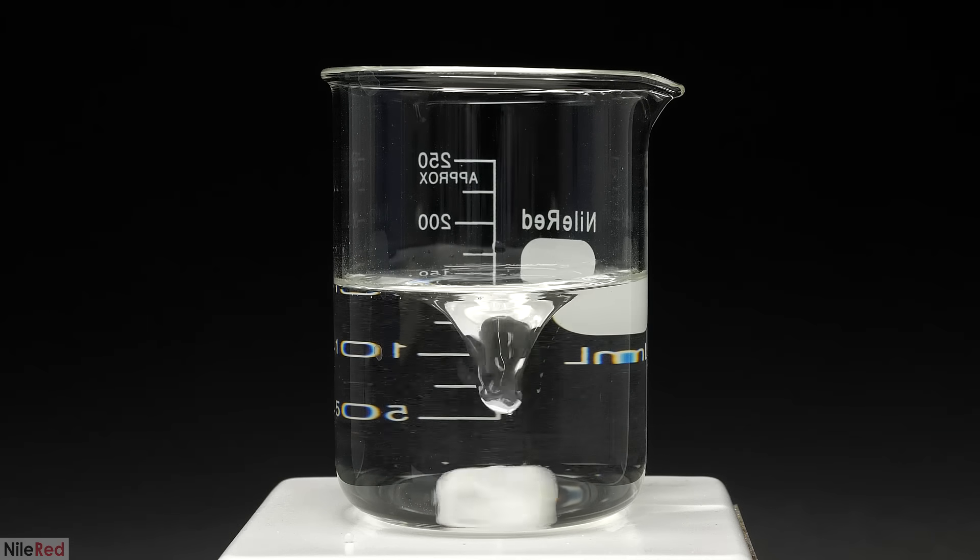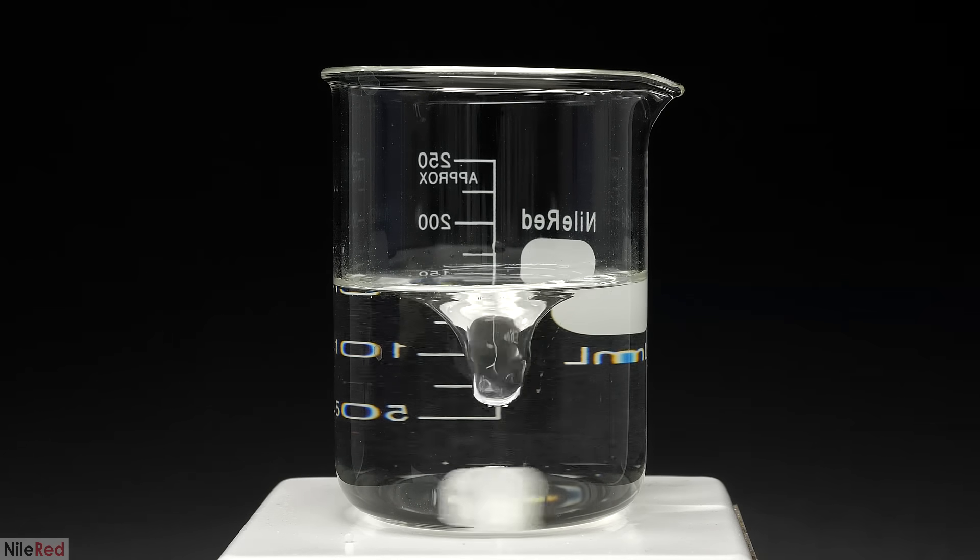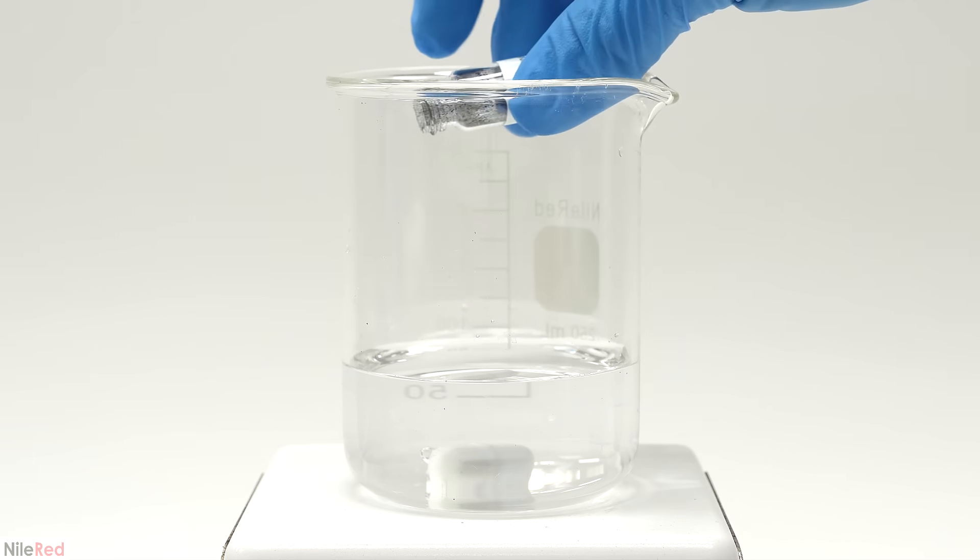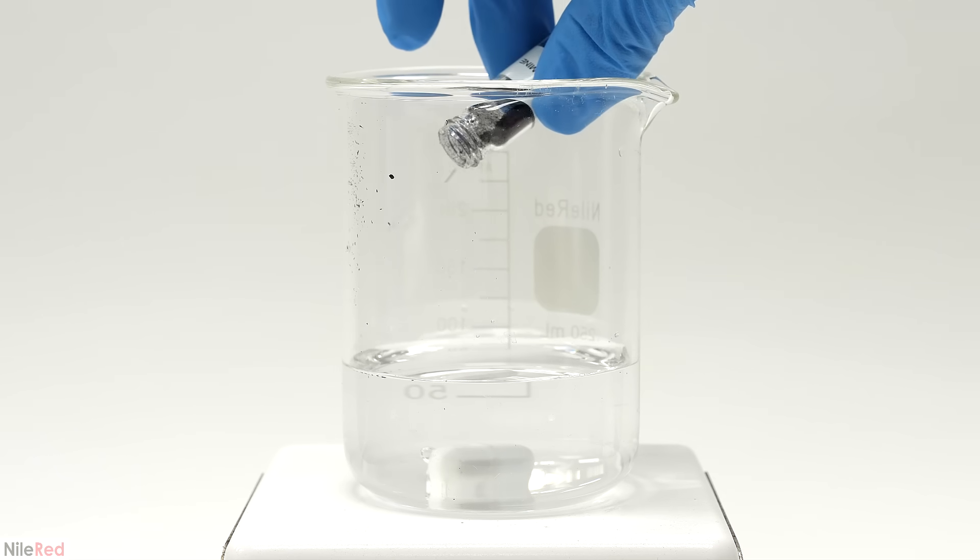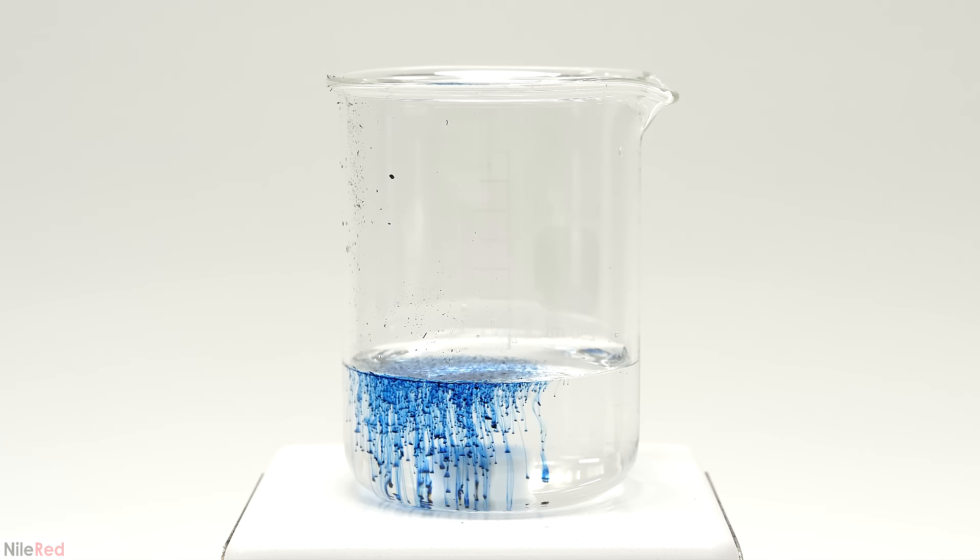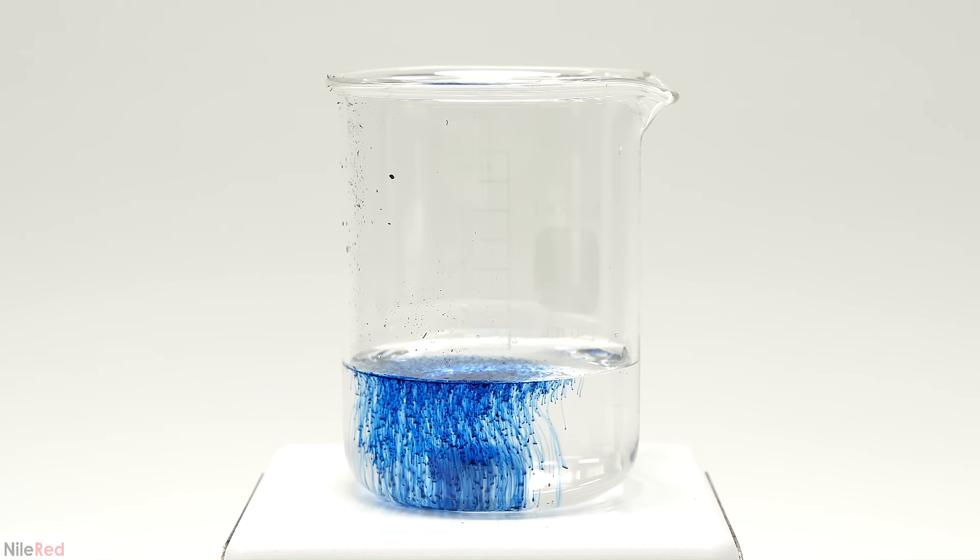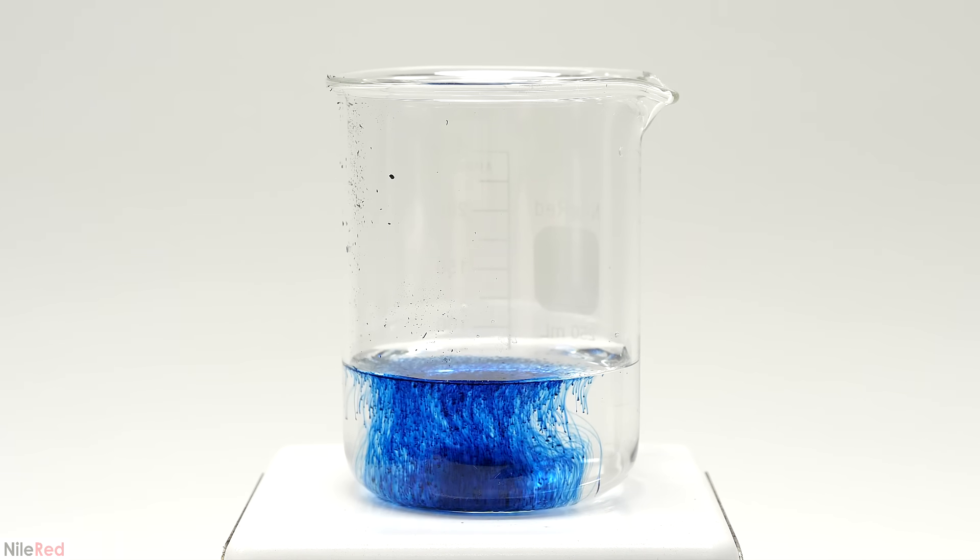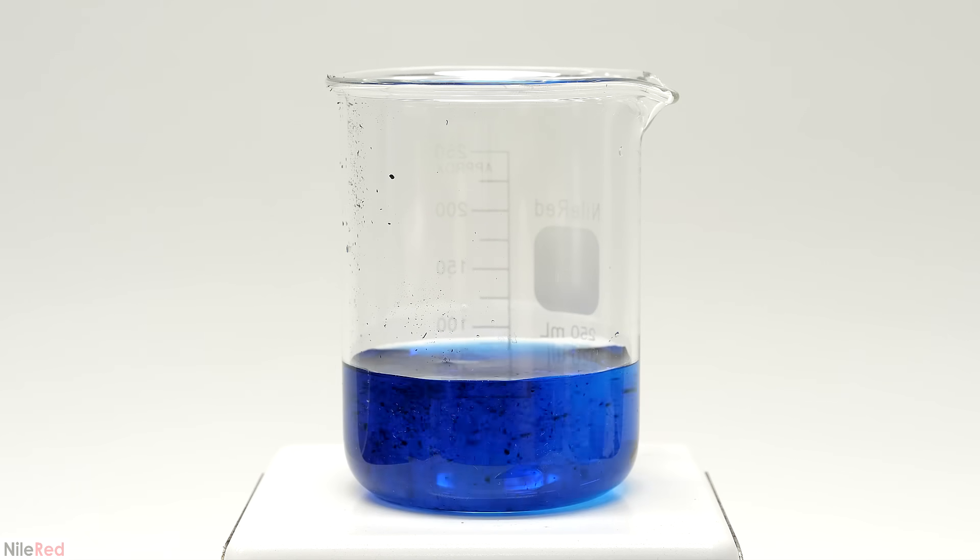To do this I measured out about 100 mils of distilled water and I added the indigo carmine. However, the amount that's needed is extremely small, somewhere around 20 milligrams, and most scales aren't able to go that low. I recently purchased some analytical scales that can do it, but while I was filming this I didn't have access to them so I just had to eyeball it.